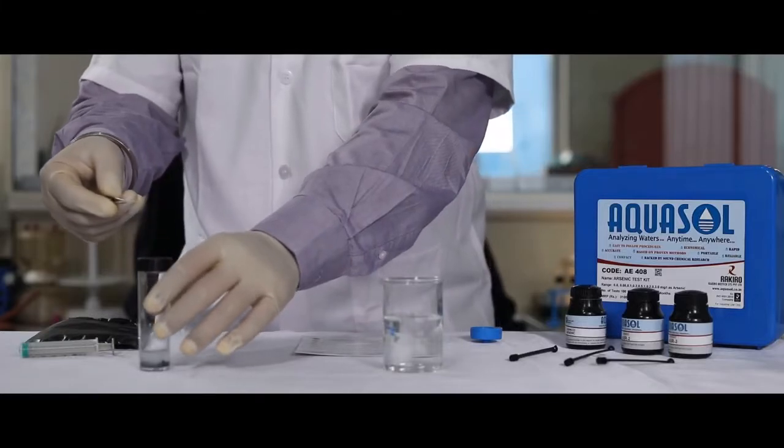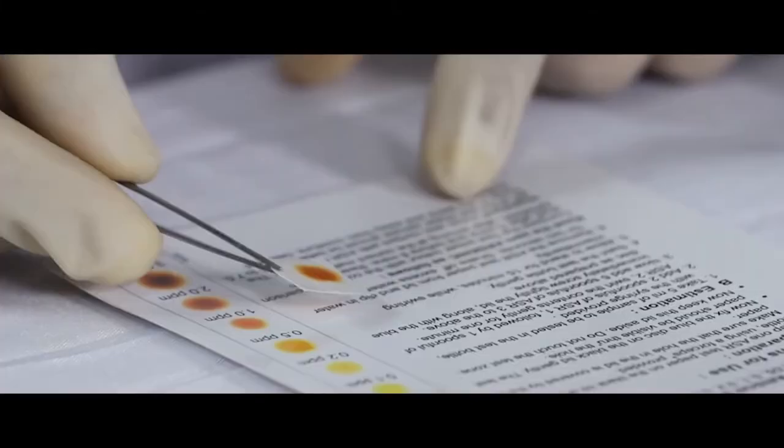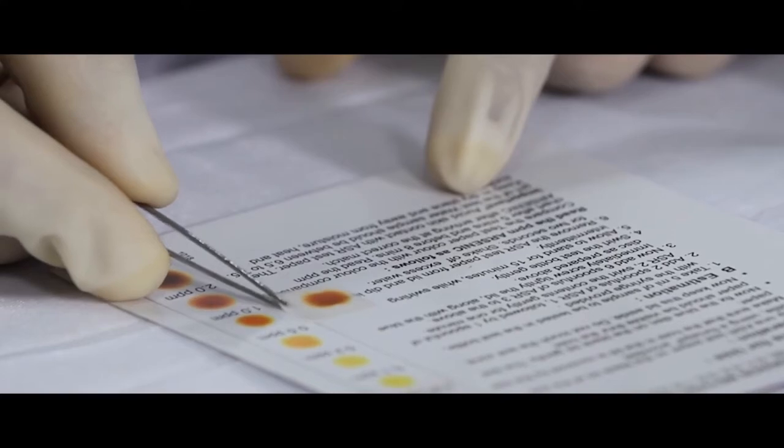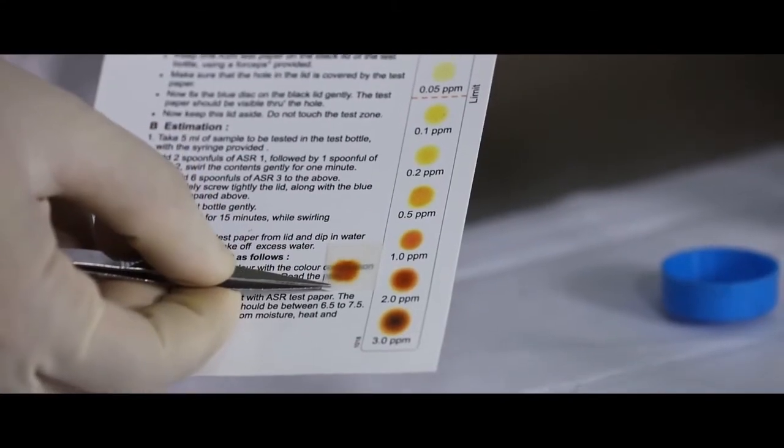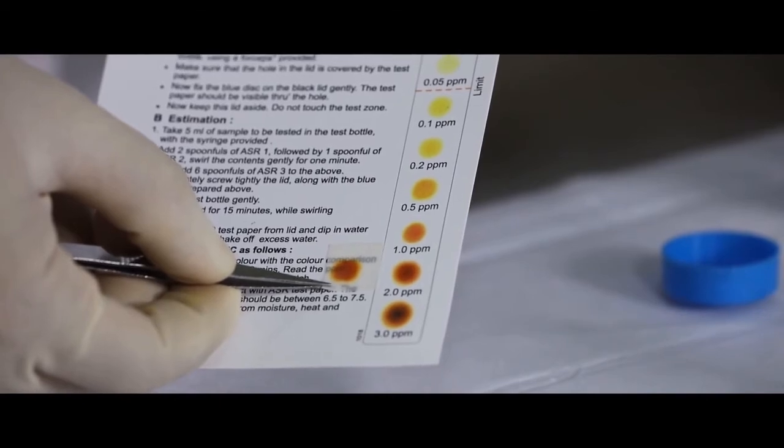Compare the color of the test paper using the chart. The matching color will indicate the PPM arsenic.